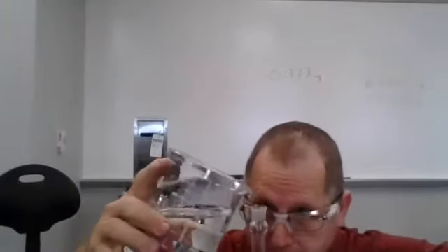Now, I hope the sound comes well through this. I am using one of my laptops from the lab because that's what I have available in order to film this. Let me get this to where you can see it. You'll also be able to see the data in the background here in a moment.